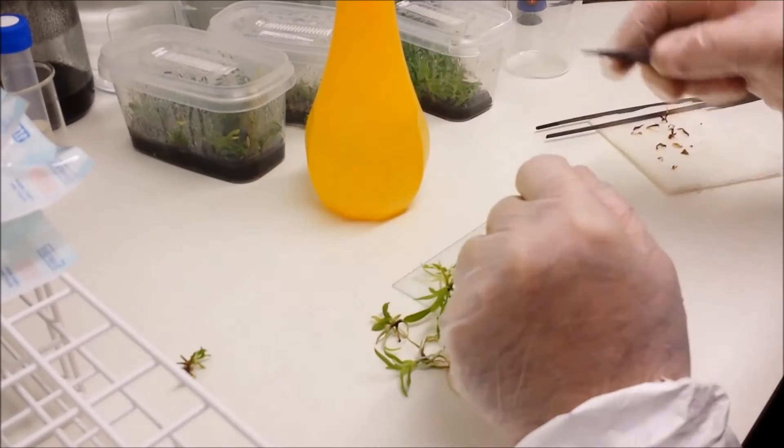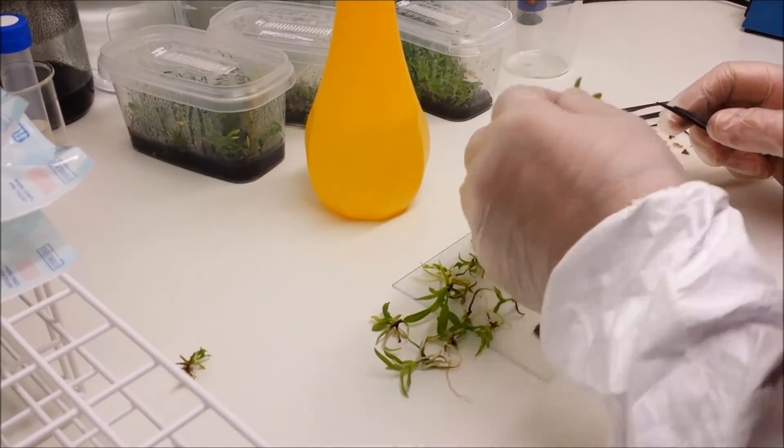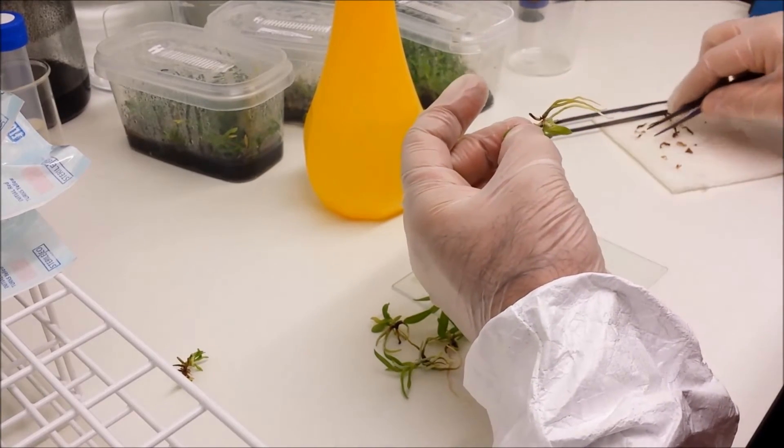That one's a little bit too small. It's actually several tiny little plants all clumped together. So I'm not going to bother with that. I'm just going to use the nice biggish ones.